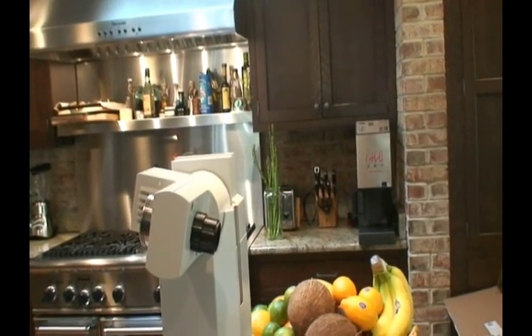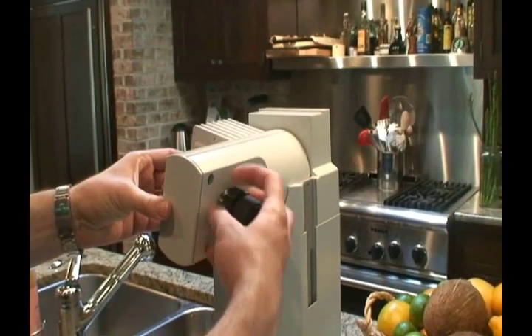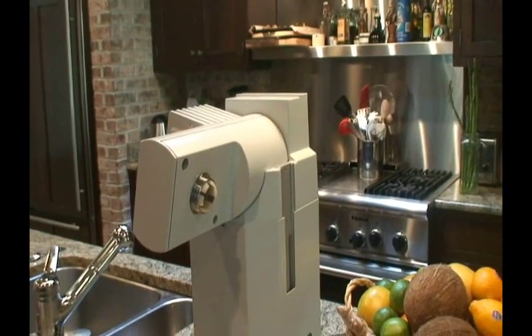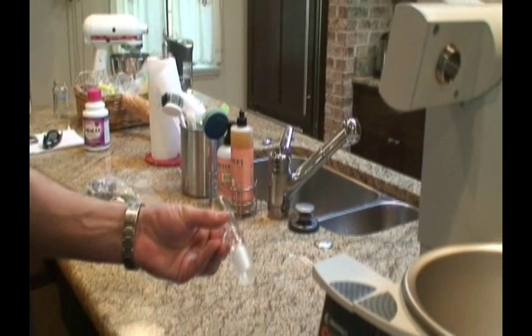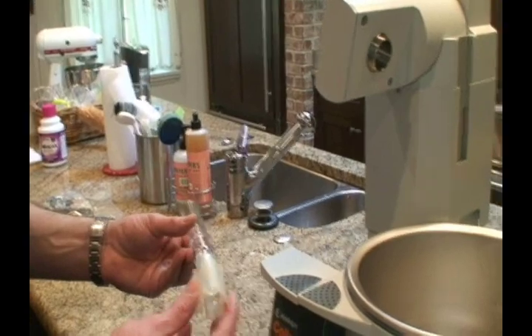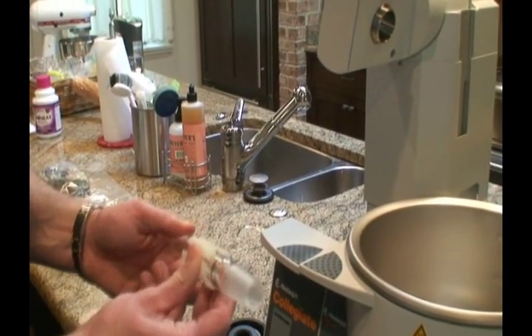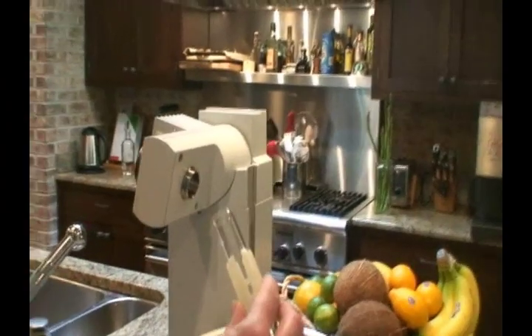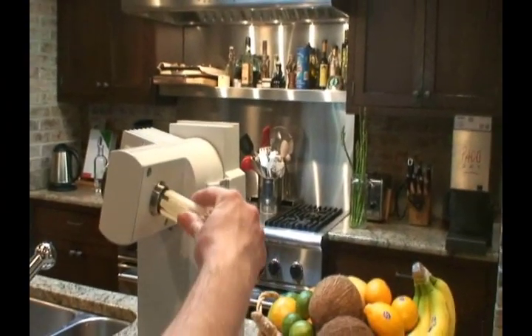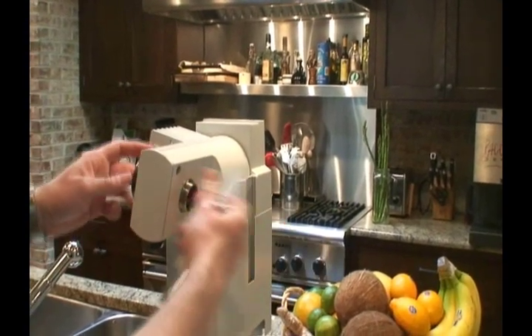These are the little plastic seals. That is referred to as the vapor duct, clamping sleeve, and clip. The plastic sleeve prevents the glass tube from being stuck within the motor drive.